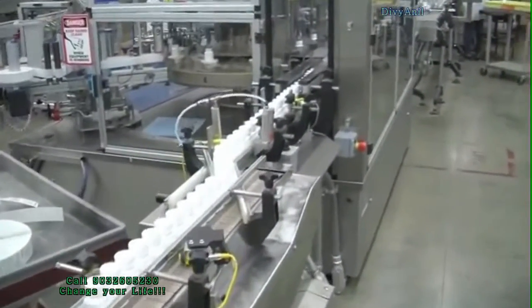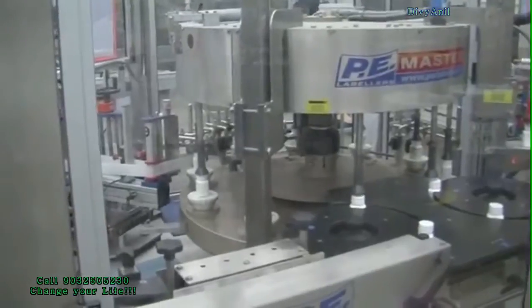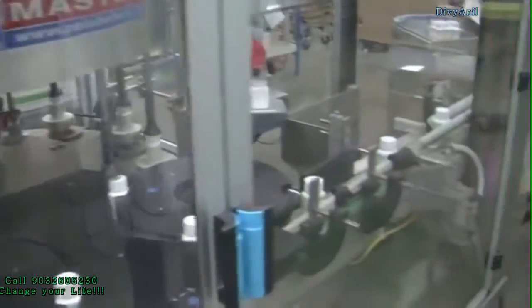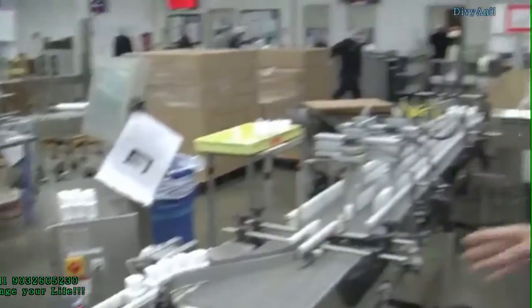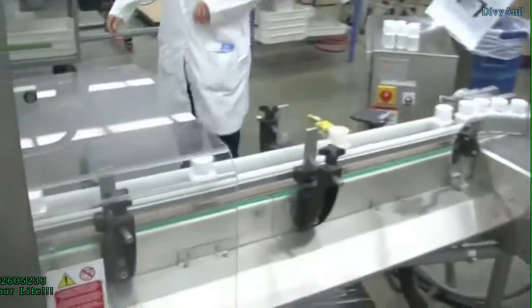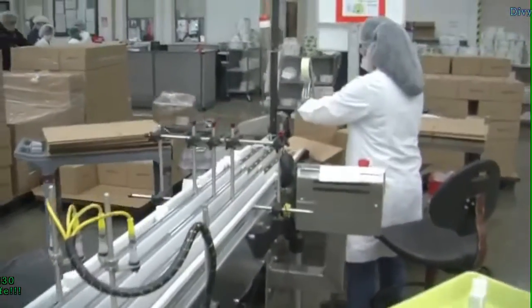Over here is where we have the labeler. The bottles go in individually into this machine and circle around it, and as they circle around it puts on a label. It's the machine's job not only to put on the label but to make sure that the label is put on correctly — put on straight and without any creases or ripples. Once the label is put on, it will come back onto the conveyor belt. This is the sensor connected to Visual Factory. When a bottle passes this yellow sensor right here, that number goes up one more. Right now since the line has stopped, you can see that Visual Factory has stopped as well. And now that it's started back on, Visual Factory is counting again. After it's all done, it goes to the final conveyor belt where the line lead will grab the bottles and insert them into a box.